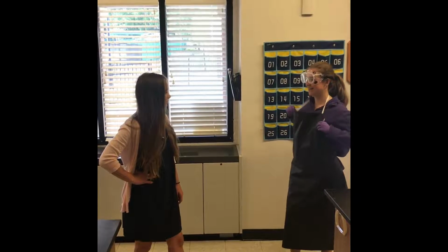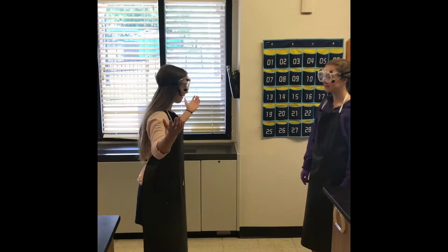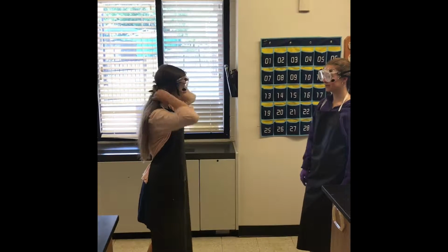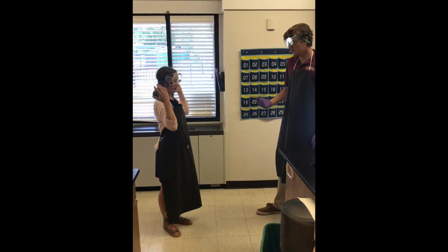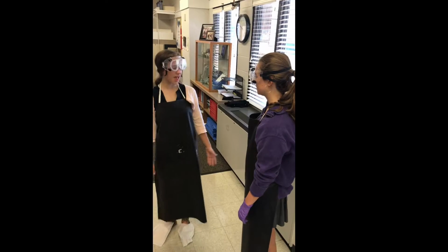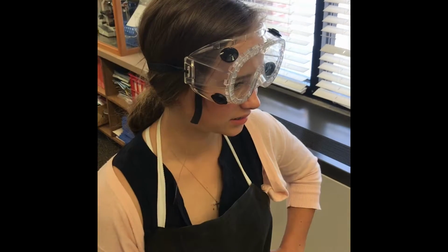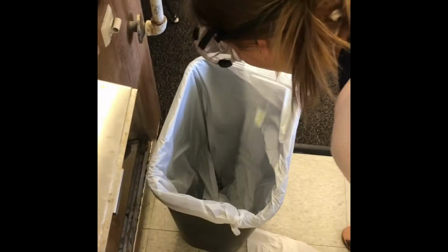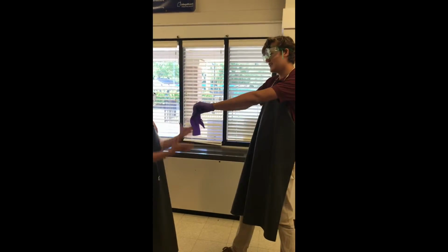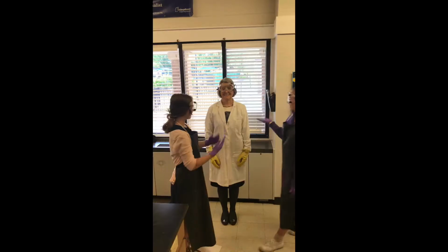I'm ready for the lab. No, you're not. You need an apron. Also, you need goggles, and you need to put your hair up. Also, for lab purposes, those shoes are atrocious. And are you chewing gum? You need to spit that out. Also, you're gonna need some of these. Also, you need adult supervision.